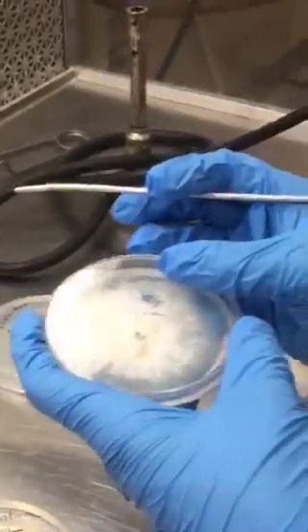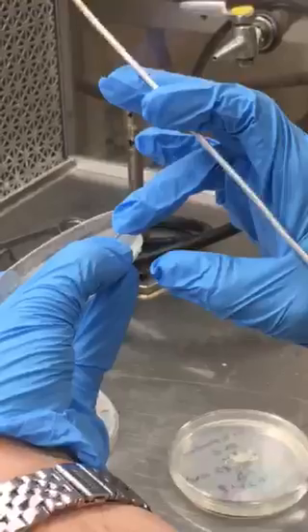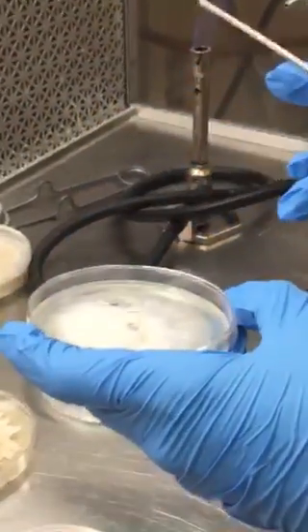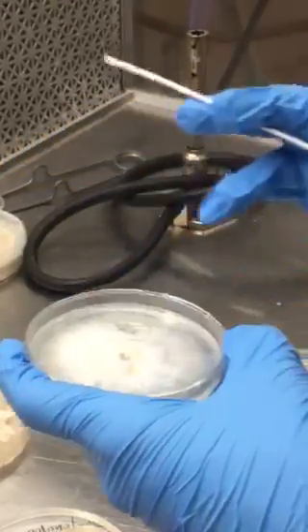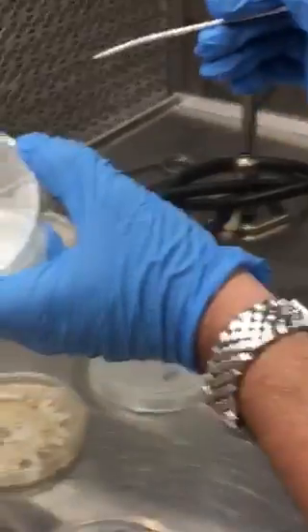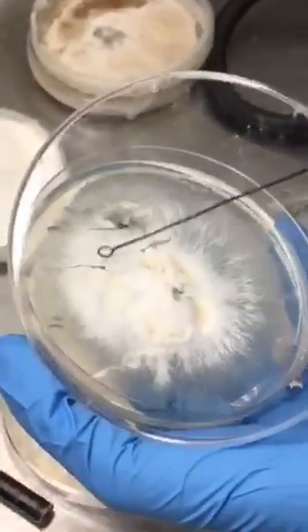I'm going to use what's called a clamshell method of opening the petri dish. This is done by pinching the petri dish with your thumb on the top edge and your pinky at the base, and kind of holding it like a CD with your pointer finger at the crease between the top and the base. Then I open it like a Pac-Man, pointing it towards the flow hood, and make a selection. In this case I'm going to cut this wedge.